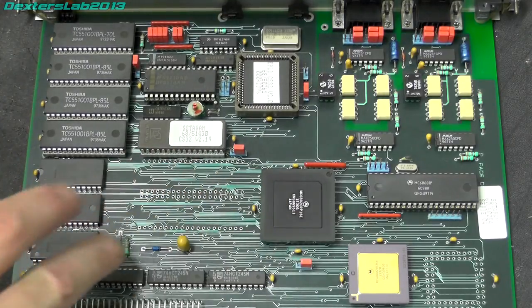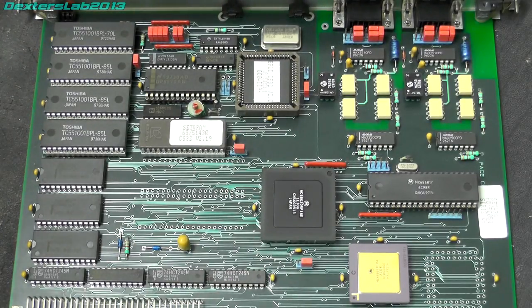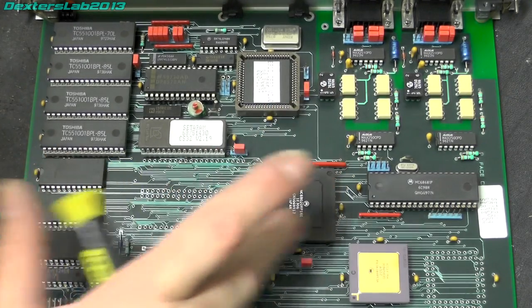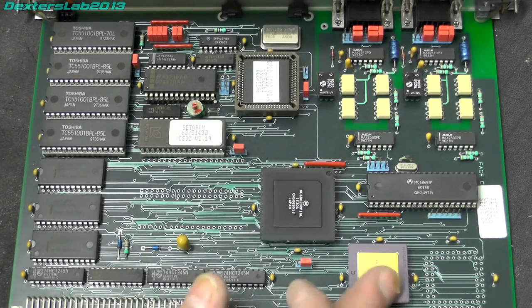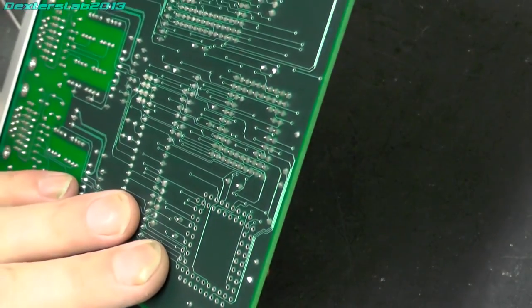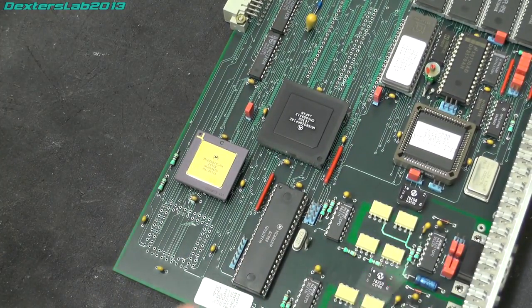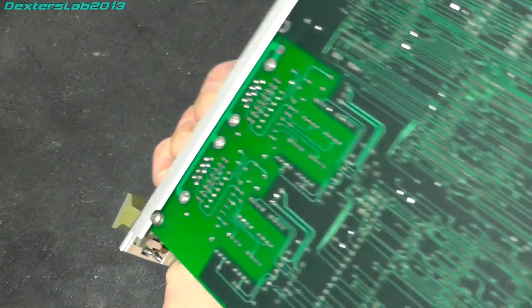Now obviously this is the main CPU and this is a Motorola 68020, which is a reasonably sized part. I mean it's got a fair bit of grunt in that, really. 16 megahertz and it's the 020 version, so yeah, I'm surprised they're using a CPU and not something like a DSP or something, maybe. Because right next to that we have a Motorola 68882 maths coprocessor. So yeah, it's an interesting combo. Go figure. So next to that we've got an empty slot there. Now that could potentially allow for a second math coprocessor, maybe. Not entirely sure. I seem to remember you could parallel them if I recall right.